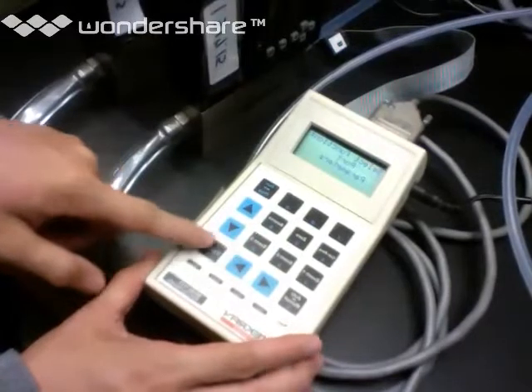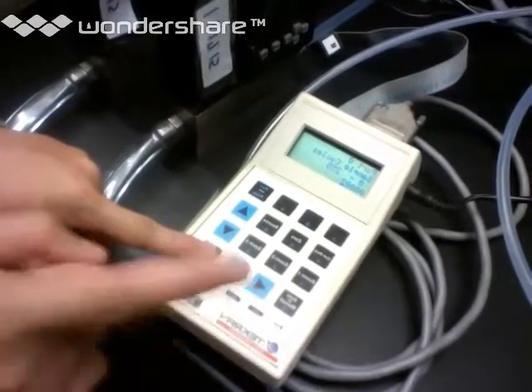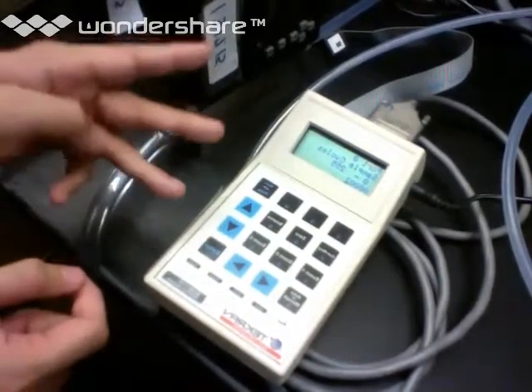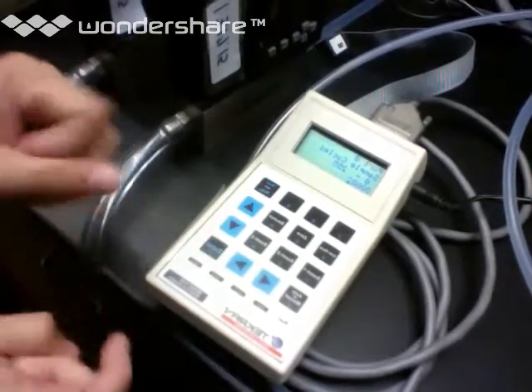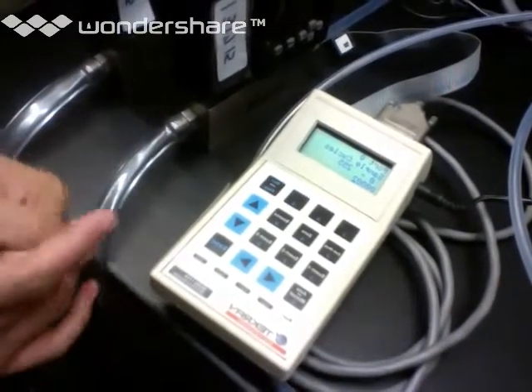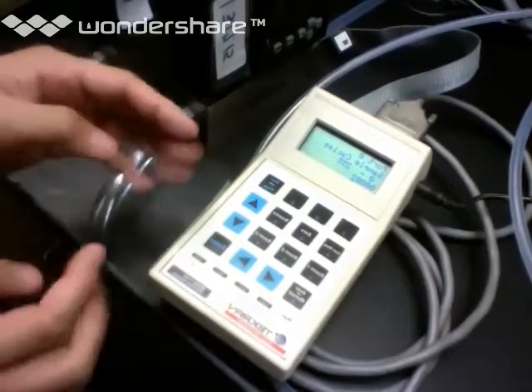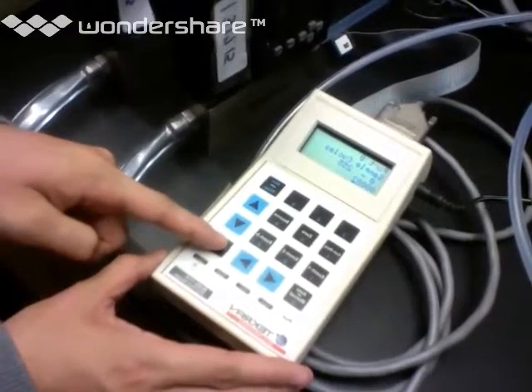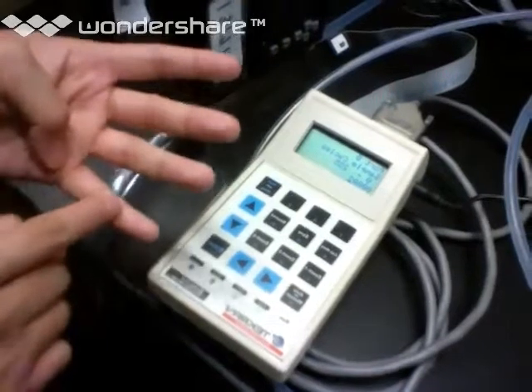So we're going to shift over to port parameters. This is the more important category. On the actual 4-port sampler, the 4 ports are labeled 0, 1, 2, and 3. You can leave it as 0, 1, 2, and 3, but occasionally port 0 can get confusing, because if you don't have a 4-port sampler, the default flag value is 0. So where's the 4th port? Well, it's 0, 1, 2, 3, so we just label it 1, 2, 3, 4.